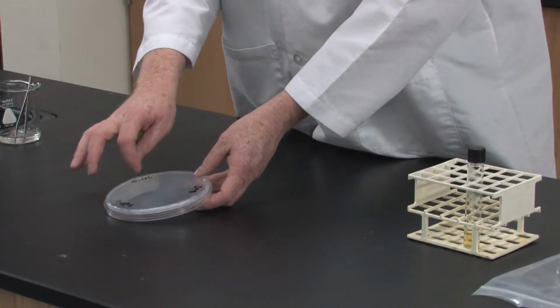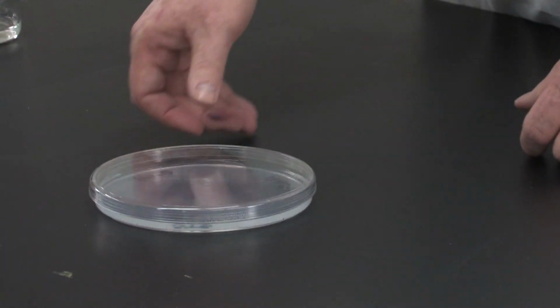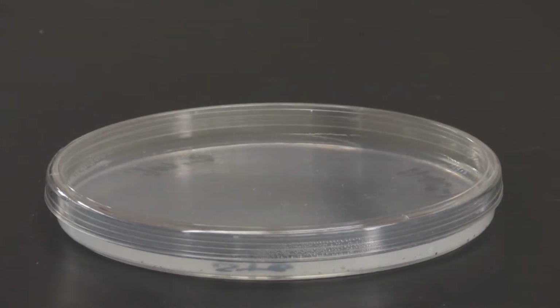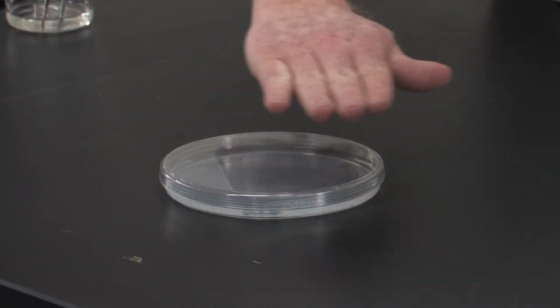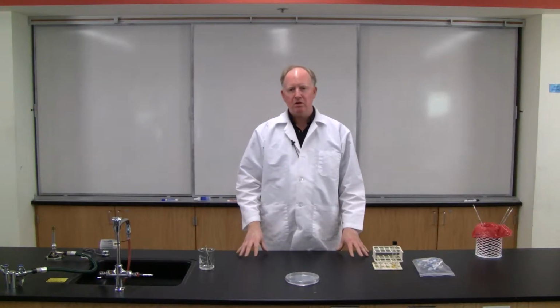We don't need to label the plate with the antibiotics because we're going to be using pre-made antibiotic discs that are actually already labeled, so the label will let you know what it is. So I've already swabbed the entire surface of this agar plate exactly as we did with the chemical disinfectant disc diffusion test. So the entire surface has been swabbed in this direction, and in this direction. So the entire surface has been inoculated with E. coli. Now all we have to do is transfer discs with various antibiotics to the surface and incubate the plate and see what kind of results we get.